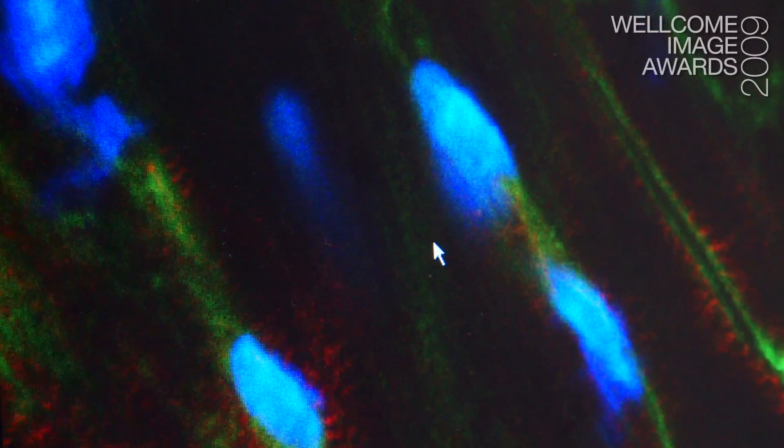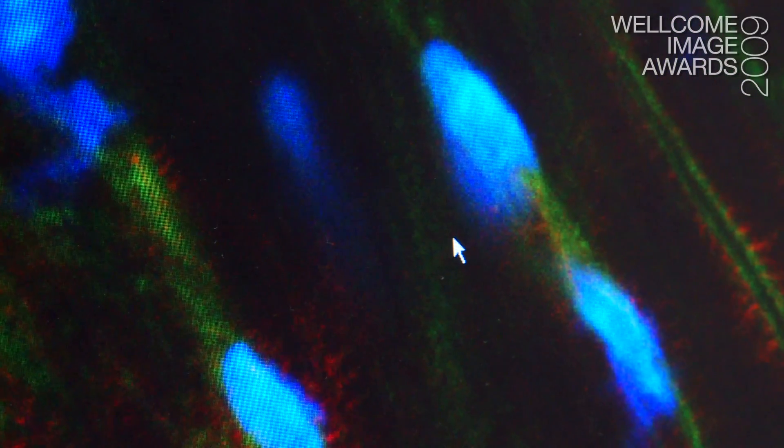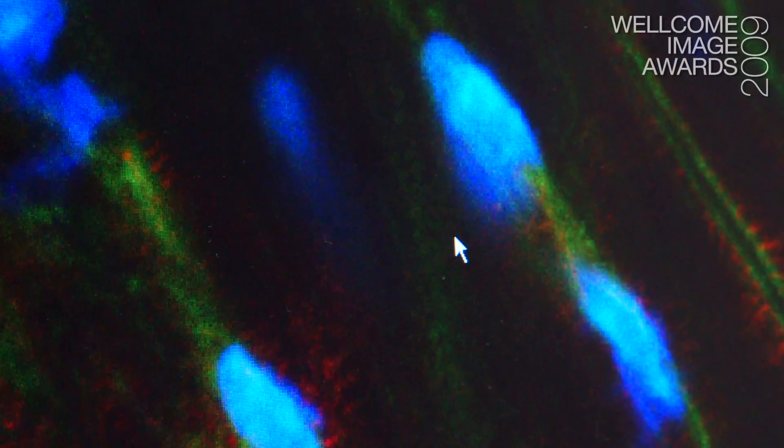Just something you just couldn't see with a conventional microscope. And that's what makes confocal so good.